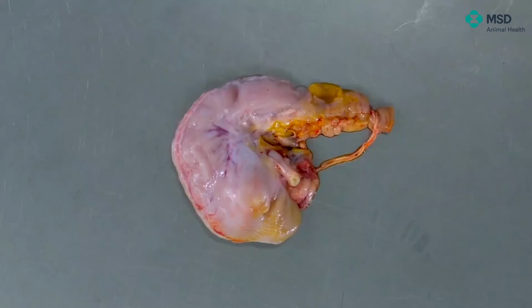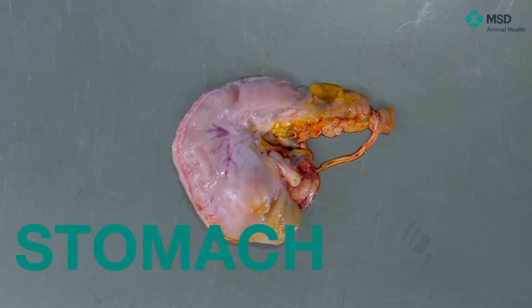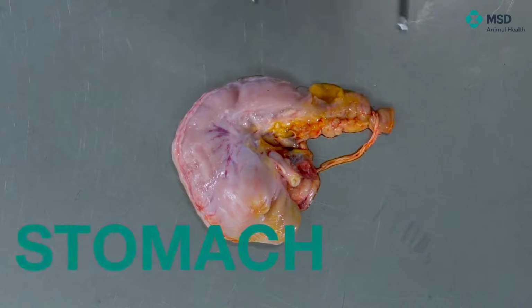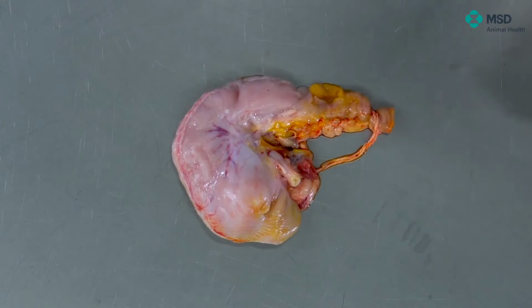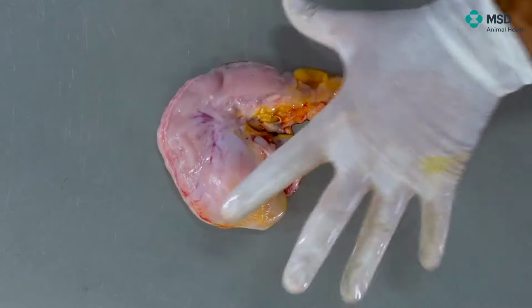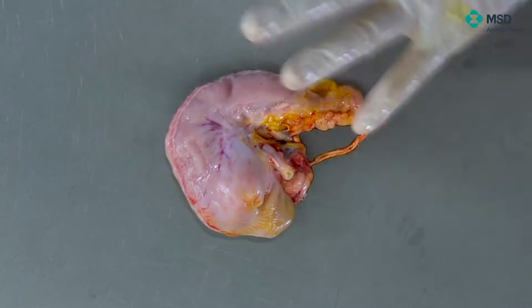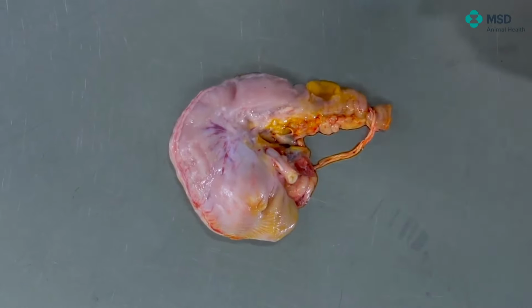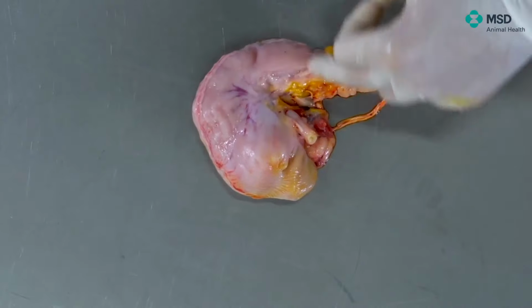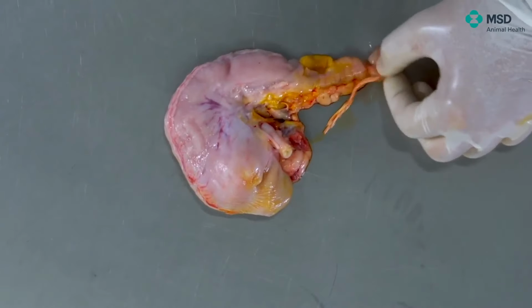Now we will study the gastroenteric tract. For the gastroenteric tract, we will start with the stomach. The stomach is a relatively easy part of the gastrointestinal tract to be analyzed, and you will see that we have a major curvature and a minor curvature. Here is the duodenum. Remember that we have been performing a knot here. We have made a cut just to analyze if the bile flow was correct.